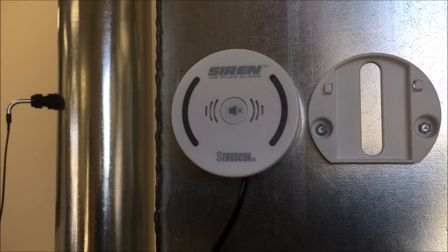In the common operational status, which is what we will be showing in this video, all of the dip switches on the back of the siren will be in the on position. When you first plug in the unit, the LED lights will flash yellow, followed by blue indicating startup and that calibration has not yet been performed.